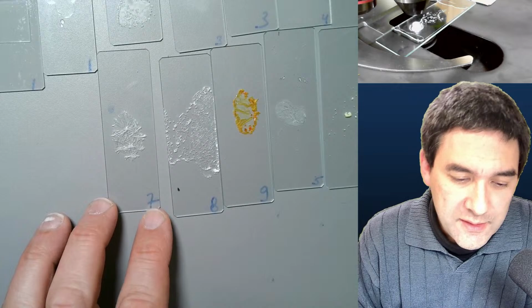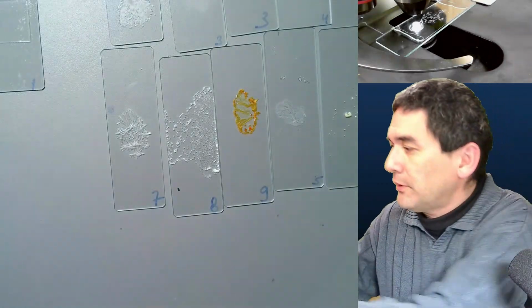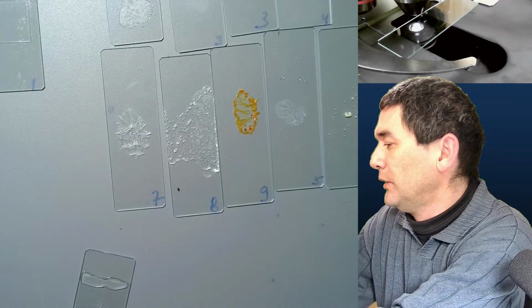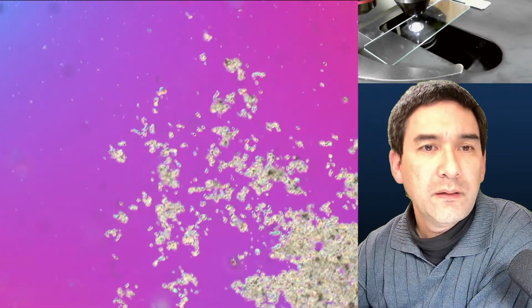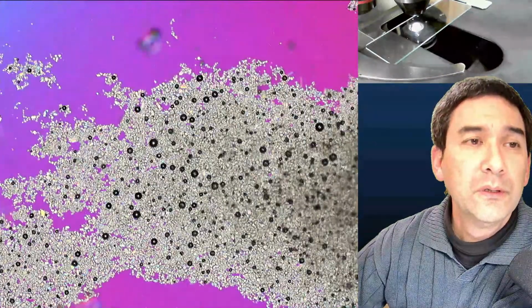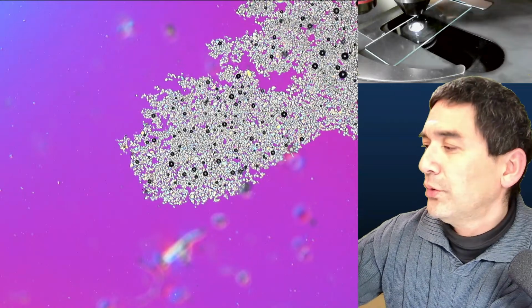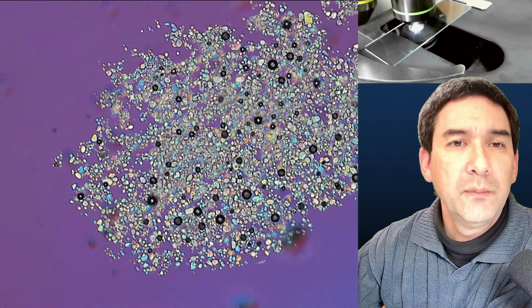Okay. So I'm going to quickly go through here. This here, number one, is potassium carbonate. Let me quickly take this out again. Okay, number one, and that is the one that we looked at before, which really doesn't like to dry. This is really interesting. As a matter of fact, it starts to become more and more liquid the longer I wait, and it seems to really absorb a lot of the moisture from the air. And now even those crystals that were present before are gone. It's attracting the moisture so much, and those crystals that are left over here look round because they're actually in the process of dissolving.